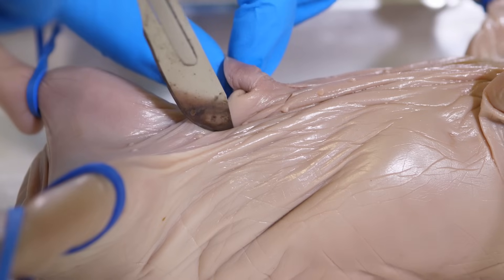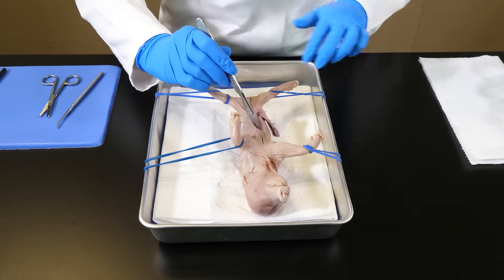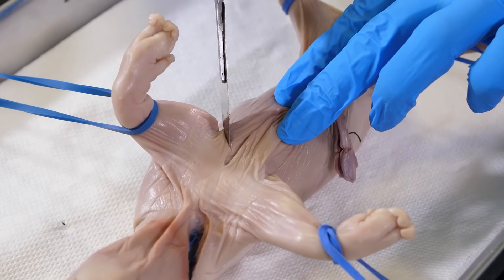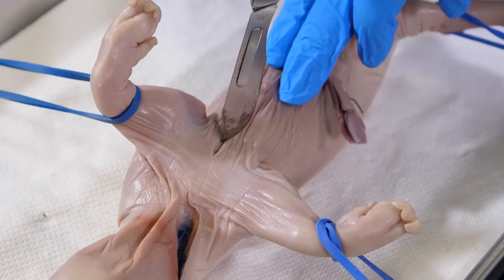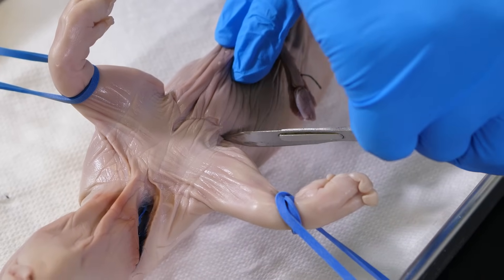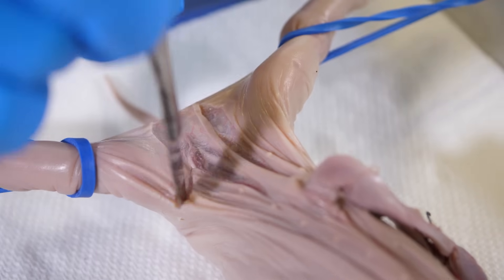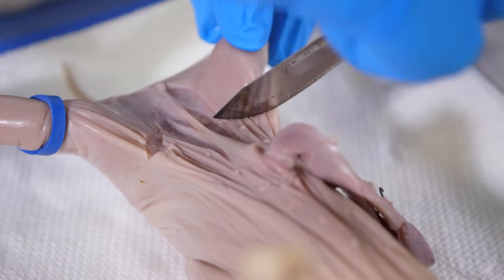We need to cut around the umbilical cord on both sides. Using the scalpel, we will make four shallow transverse incisions. We begin at the anterior end of the medial incision and cut diagonally, just posterior to the foreleg. This incision is repeated on the other side. Next, we make a transverse cut just anterior to the hind leg, starting at the medial incision. This incision is repeated on the other side.